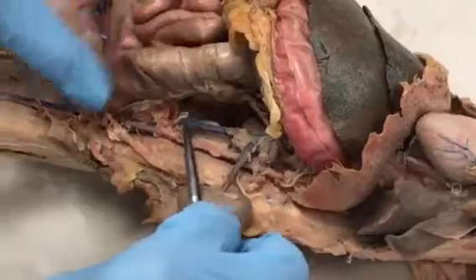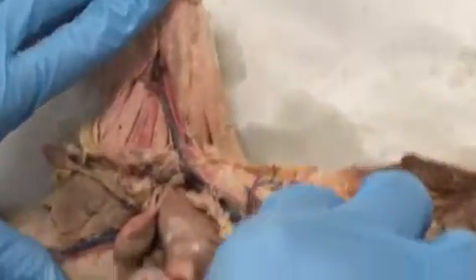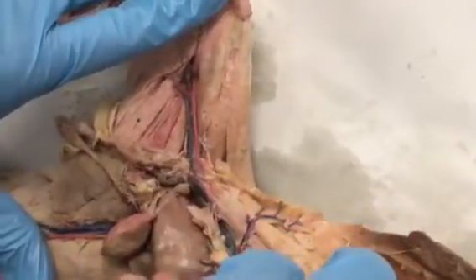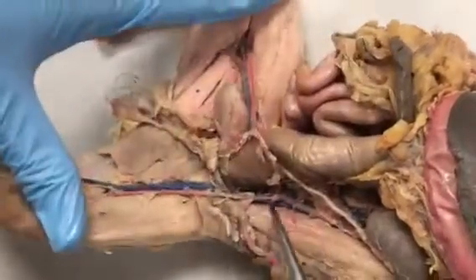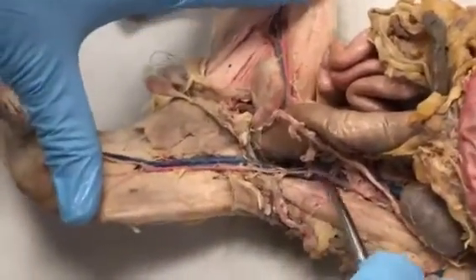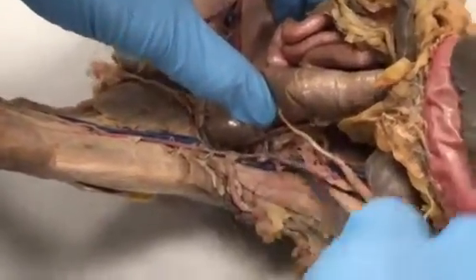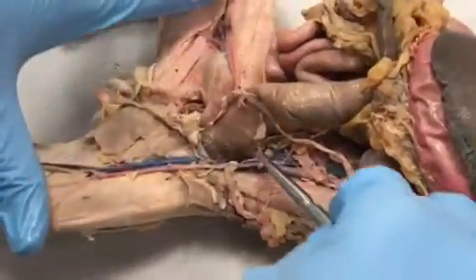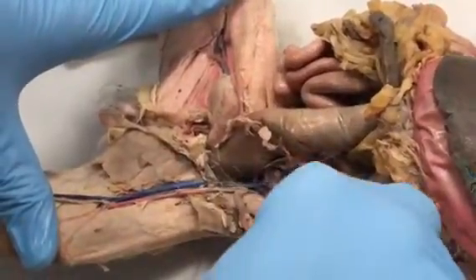And then we'll continue on down, and as before, we're going to come down to the Iliolumbar Vein, which runs right parallel with the iliolumbar artery right here. That is the Iliolumbar Vein. In this case, it's on the right-hand side. For whatever reason, it is not intact on the left-hand side on this particular cat. And then we have this branching of the postcava. So I'm going to lift up the aorta here, sort of move it aside so you can see the branching of the postcava. And the postcava will branch into the left and right common iliac veins.